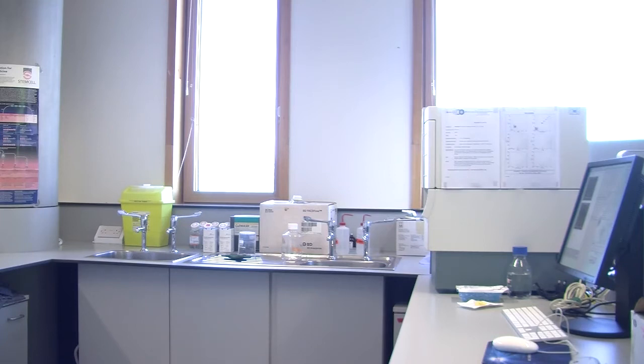We don't want them to bind to anything. That's the thing. The companies actually market them as such. So when they sell a kit, they sell specific isotype controls. They're the same in every way. Same isotype, same animals, same fluorochrome, same chemistry. It's just that they won't bind to anything specific.